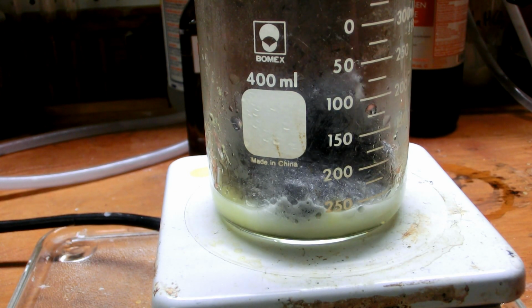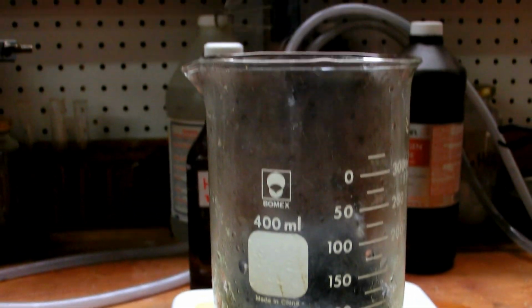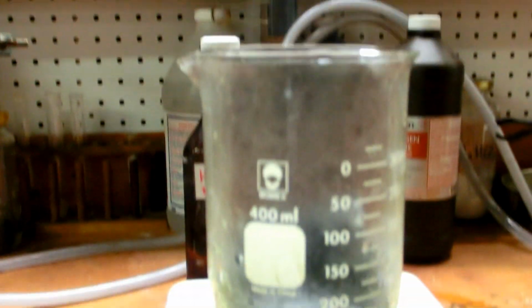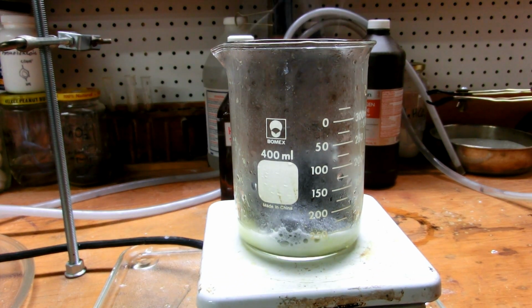Now, be careful when you do this, because the reaction is exothermic. It will heat the hydrochloric acid up and liberate hydrogen chloride gas, which, as you can see, is fuming out of the beaker right now, and up into my convenient suction tube. So unless you have a suction tube, I would advise doing this outside, because hydrogen chloride vapors are extremely corrosive, and everything in your lab is going to start rusting very quickly. And also it's bad for your health, so don't do it.